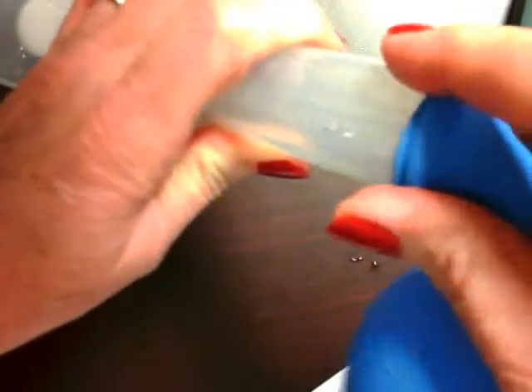So now what I want to do is release this carbon dioxide. That's what I have in my balloon, carbon dioxide right here. So I'm going to release that gas, and I think you'll be able to hear it. There it went. And now I'm going to put everything back on the scale.